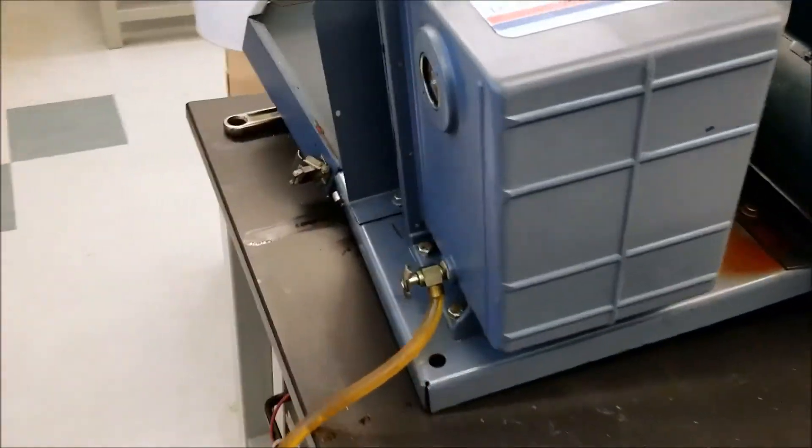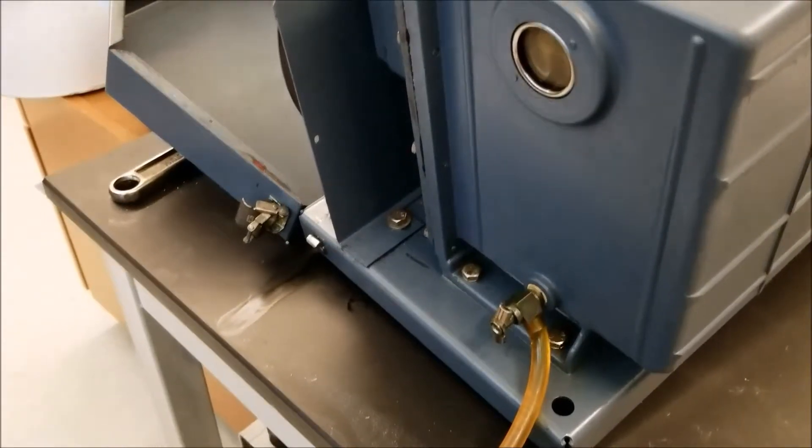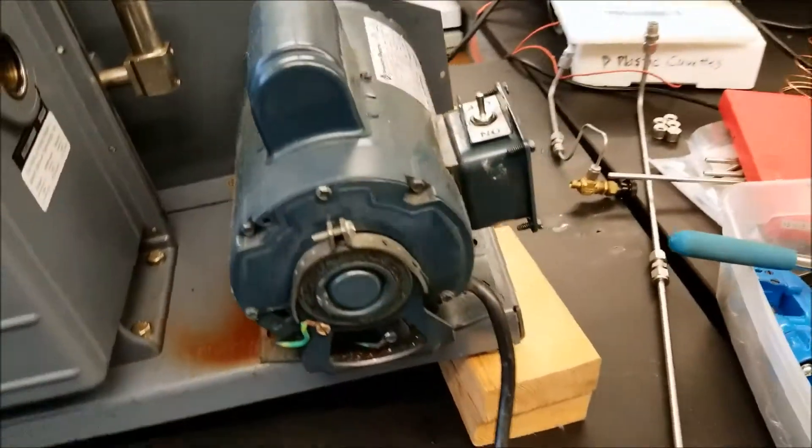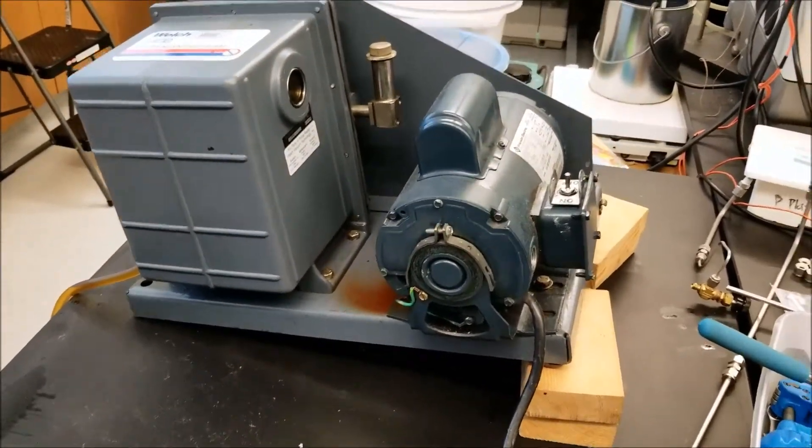So you set it up like this. There's a little spigot here on the end. So you attach a hose and a little collection bin like I have down there, open it, and on this side I set up several wood blocks so that gravity can further do some of its work and help relieve the oil.